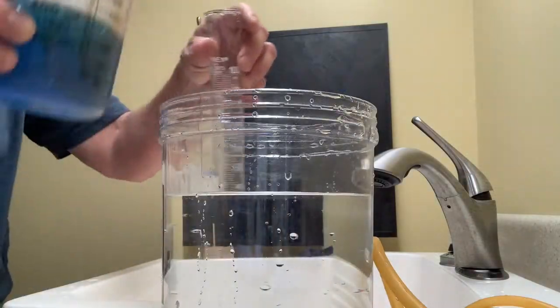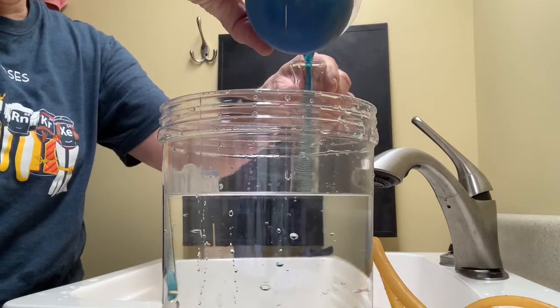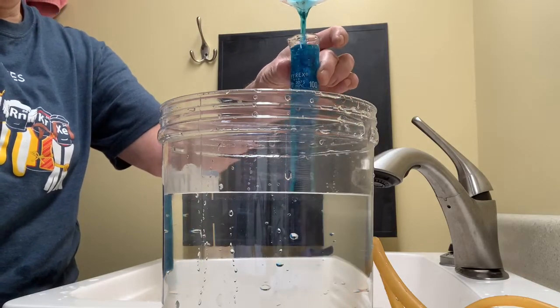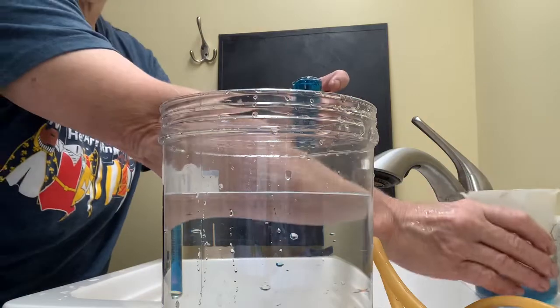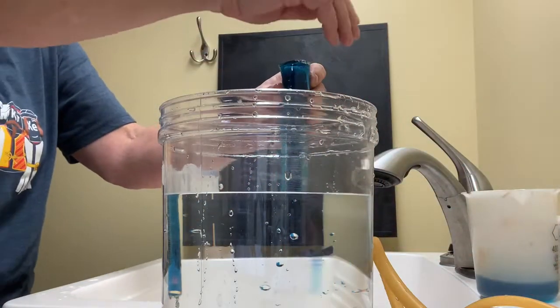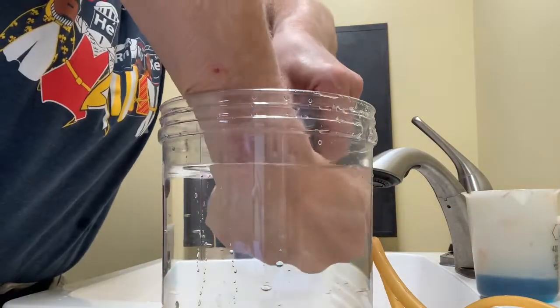I'll fill the grad cylinder up with water that's been colored blue just to make it a little bit easier to see in contrast to the clear colorless water in the bucket.